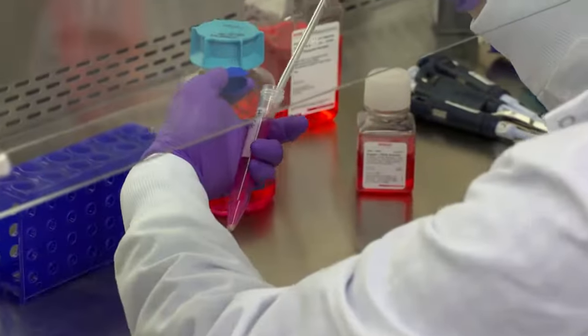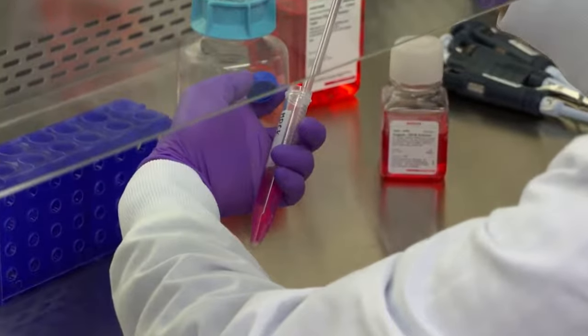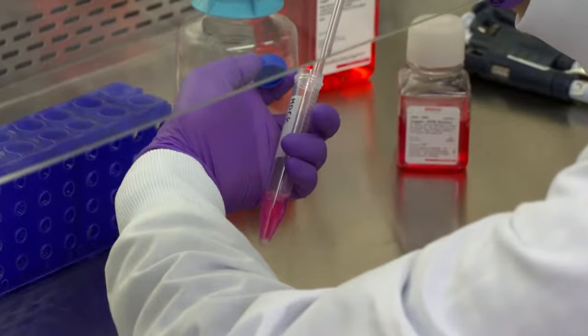I would like to share some of the key watchouts and considerations that should go into passaging of adherent cells.